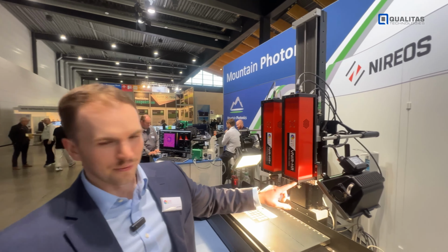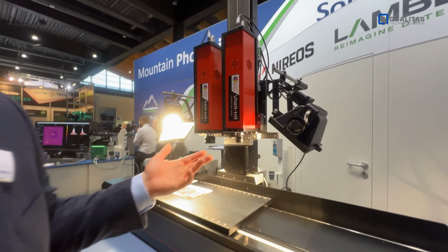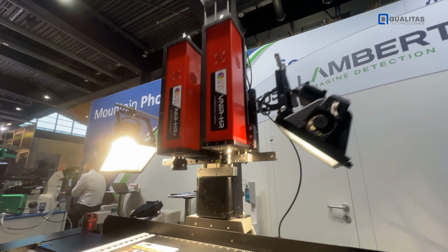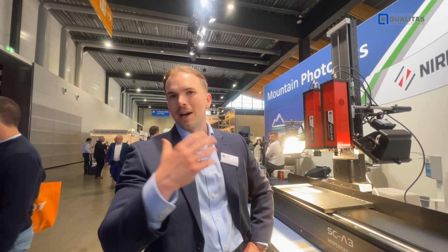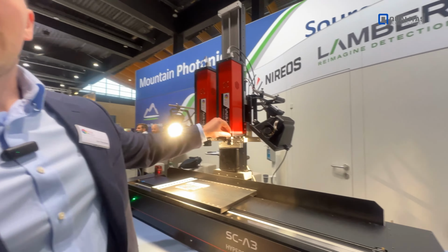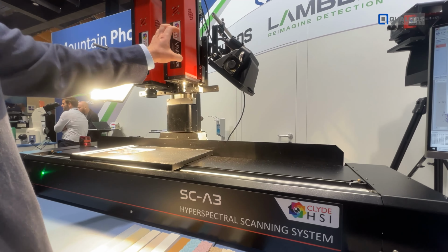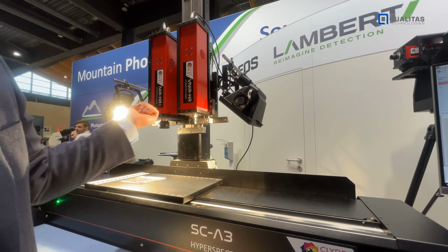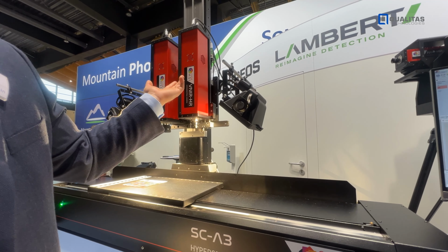In here we have the lens on the front of the camera, which has a specified focal length. Just like a normal camera, you can interchange the lens and measure things at higher resolution or lower resolution, high speed, low speed. Behind this, we have the collimating optics, which focuses onto the spectrograph, which takes the white light from the lamp and splits that light into the hundreds of colours of the rainbow.